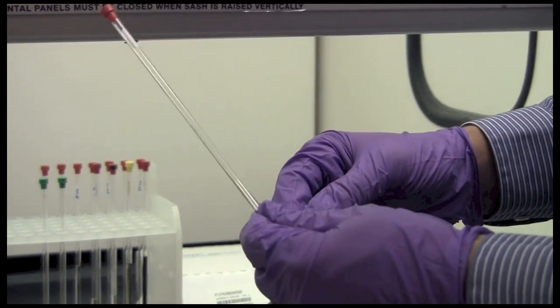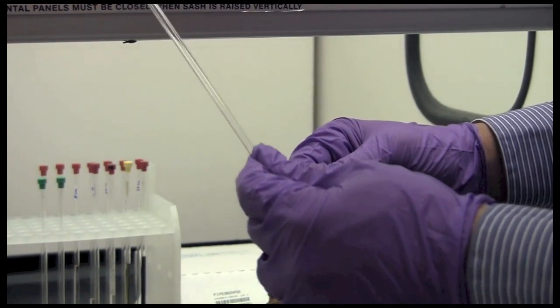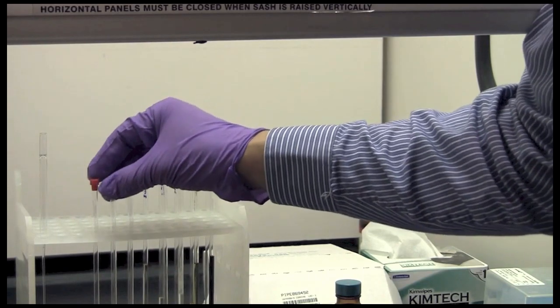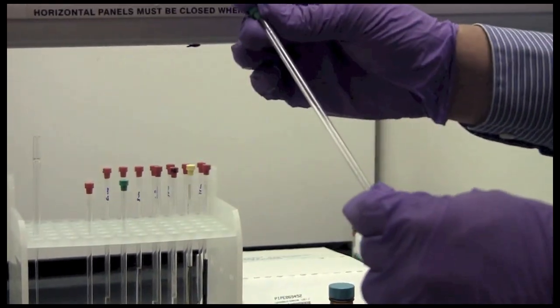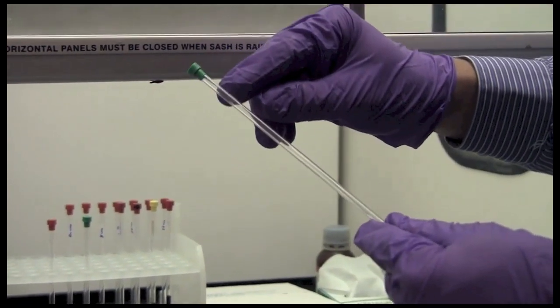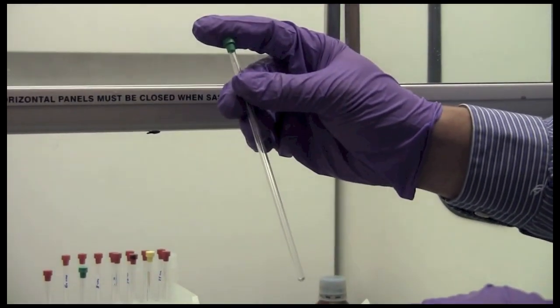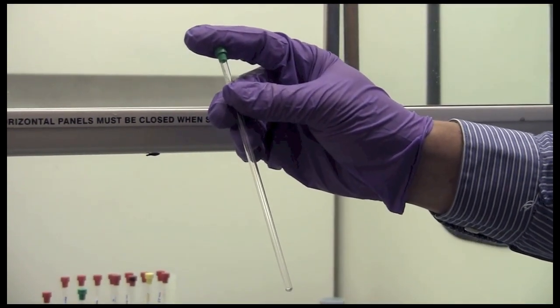If you get a bad data set you may want to consider trying a better tube. The tubes I recommend that you use for routine data collection are rated for 400 MHz and are labeled with WG1228. These ones should give you reasonable data for any normal NMR sample.